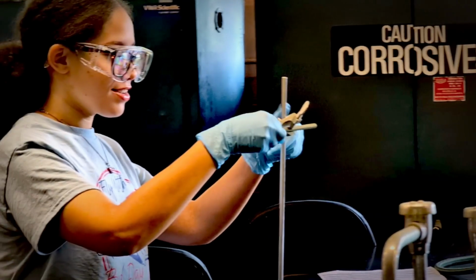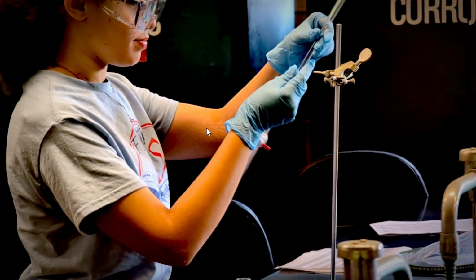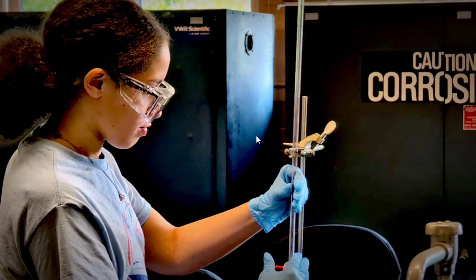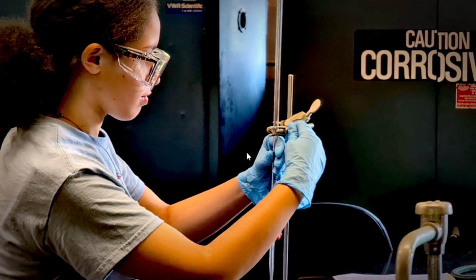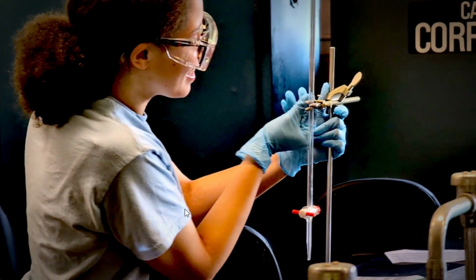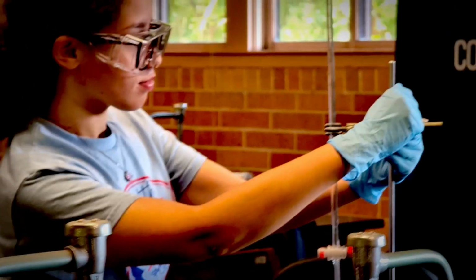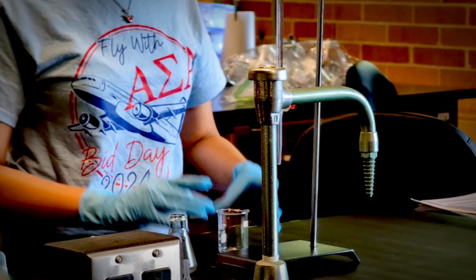That is your stand. After your stand, you're going to add the connector to the stand. Again, you might have a plastic connector. Just make sure that you connect it. On one side is going to be the metal stand, on the other side is going to be your burette. Make sure that your burette is straight, make sure that it's tight, make sure that it doesn't shake. The burette is actually not plastic, it's glass, so make sure that you don't drop it because it's going to break. Make sure that your burette is in the closed position. If you look at the little stopcock at the bottom, it should be in the closed position before you do any experiment.